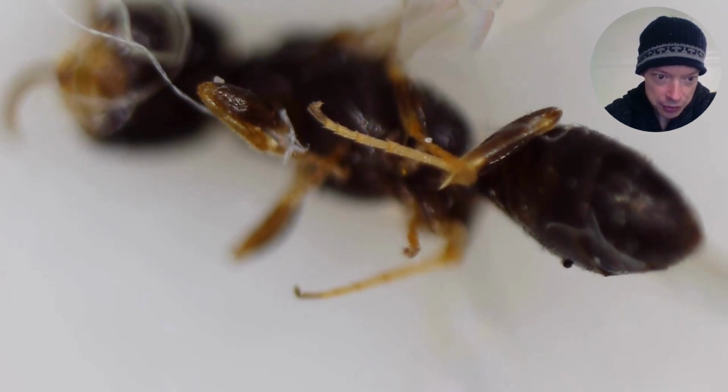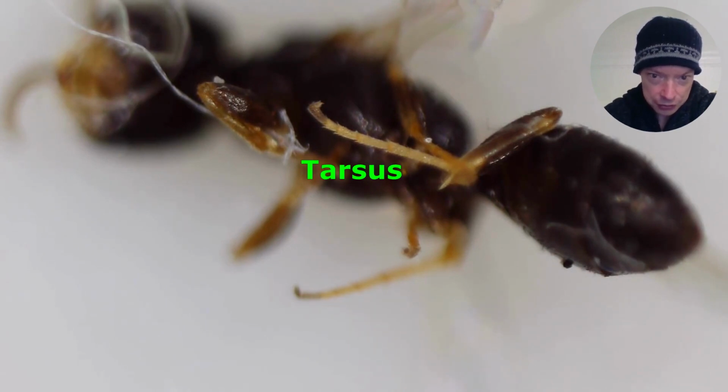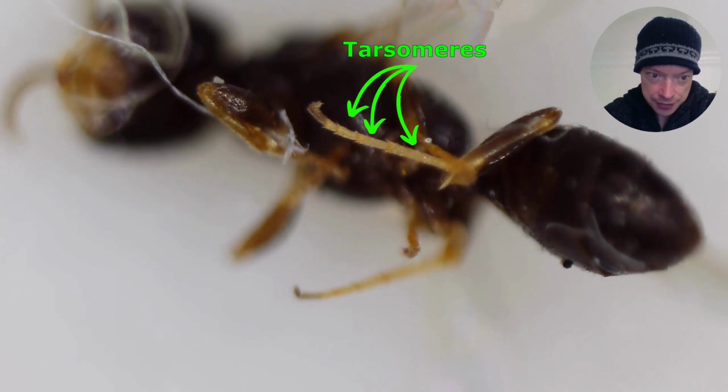If you look closely on the back leg, you can see a little spike. That's called the tibial spur, and it sticks out of the tibia. Then there's the leg segment in front, which is called the tarsus, which is the last leg segment of an insect. The tarsus tends to be divided into a few parts. Each segment of the tarsus is called a tarsomere, and the first tarsomere is the longest one.